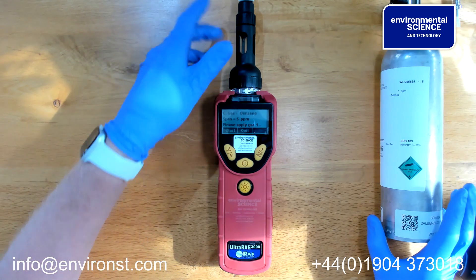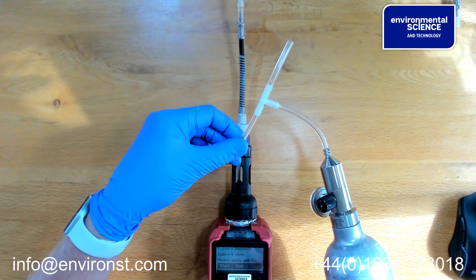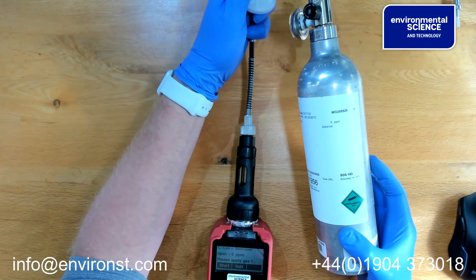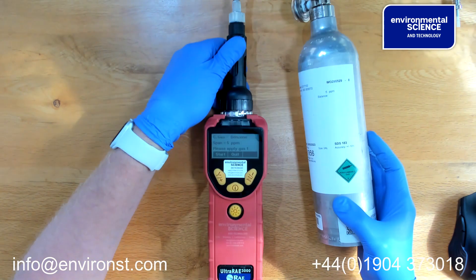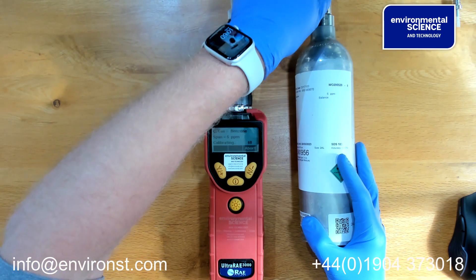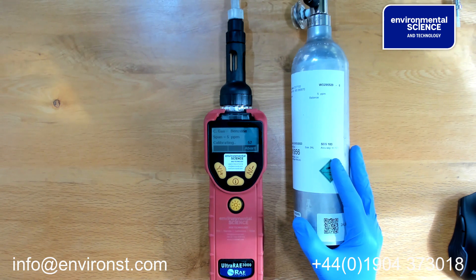You should never need to press start — just take the calibration gas and with your T-piece or on-demand flow regulator, apply it to the front of the probe. You then turn on the gas. The unit auto-starts and after 60 seconds the unit will have calibrated.